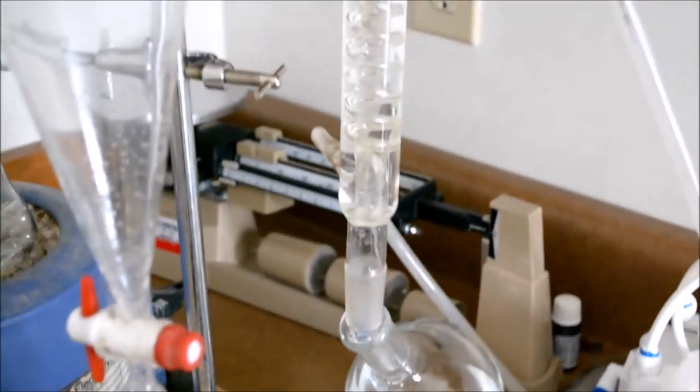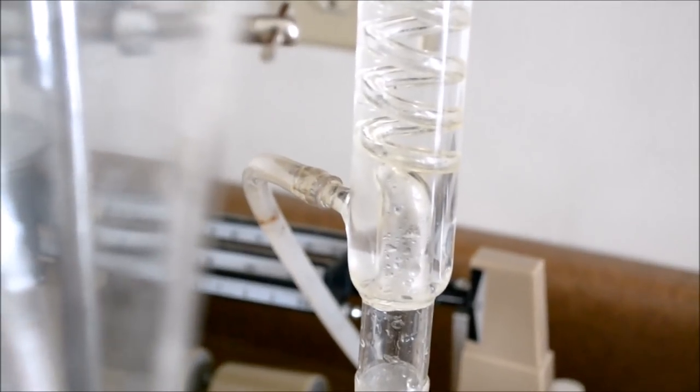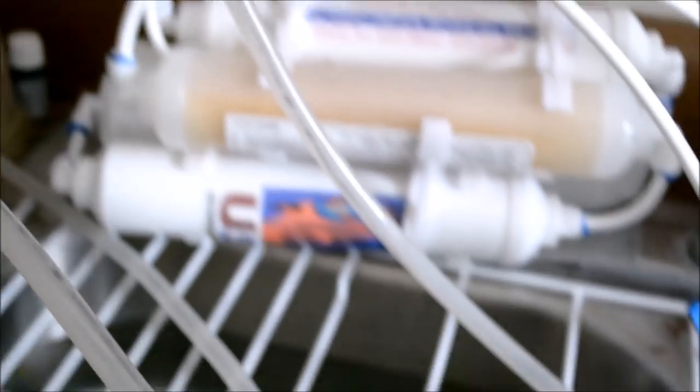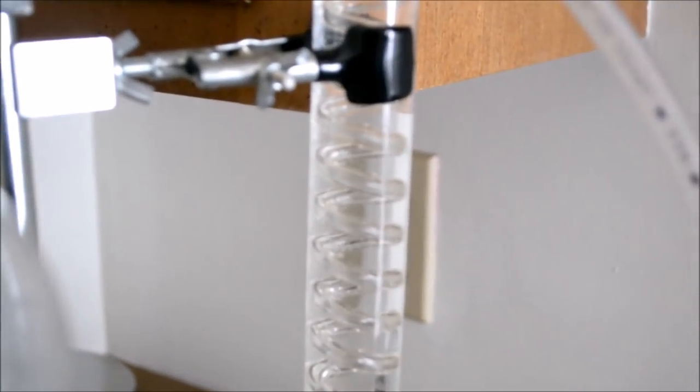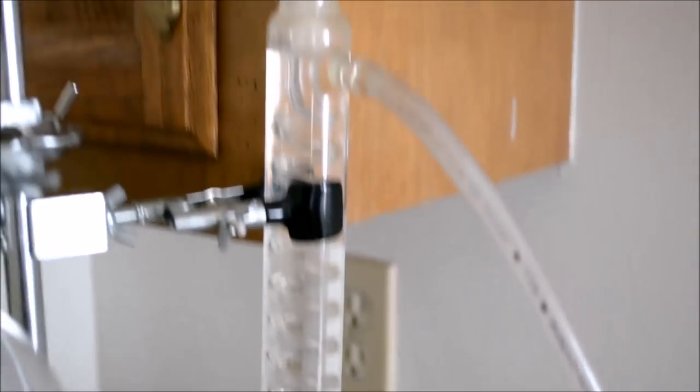Getting a little lost here, starting at the bottom. It's good to start at the bottom and have the pump push the water all the way to the top where it can drain back into the sink. And that is important for getting complete coverage around the coils.